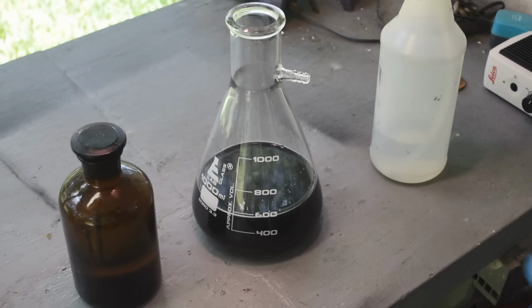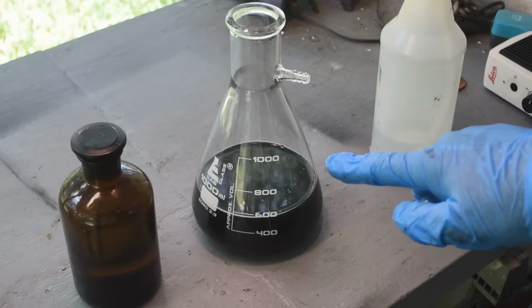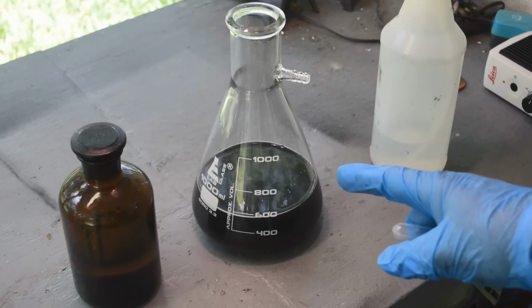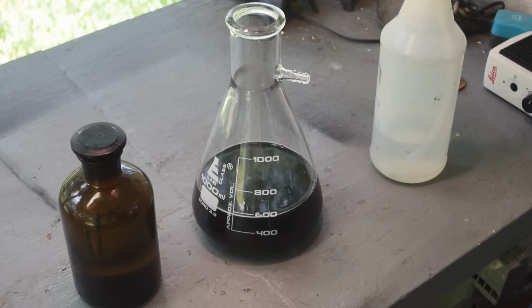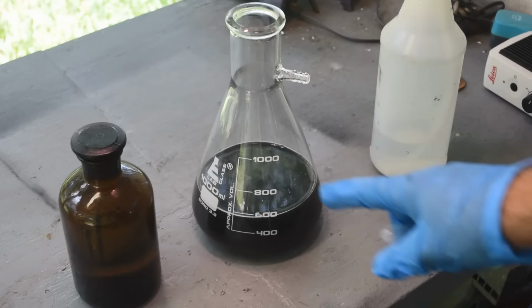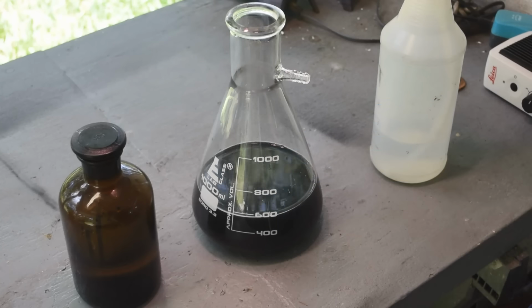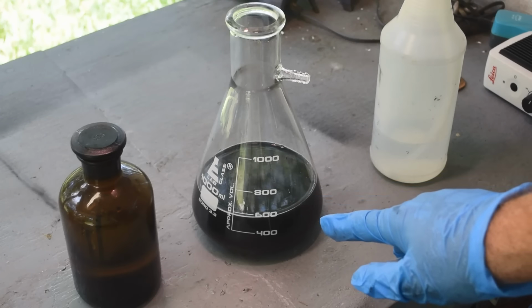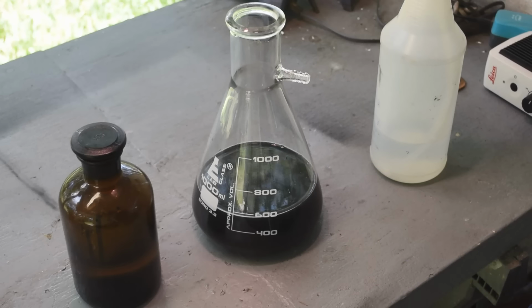All right, now the question arises of what to do with this stuff. I've got an idea there. I don't want it to go to waste. I was just going to dump this in my stock pot and let it mingle with the black powders accumulating in the bottom of my stock pot. This stuff is so fine, it'll probably just give me trouble in the future again when I try to process my stock pot. So I'm thinking I should probably put this into solution and let it come out of solution again on the copper I keep in my stock pot. Maybe it'll be more manageable.